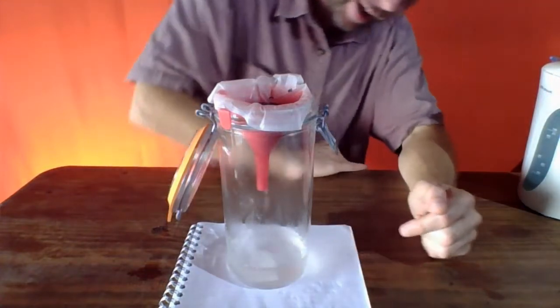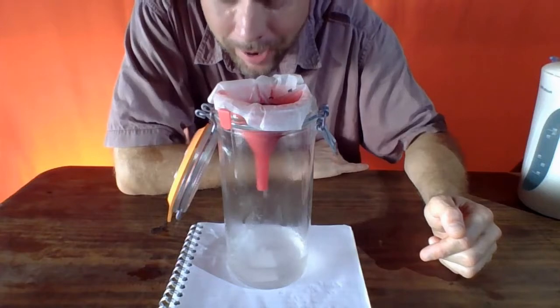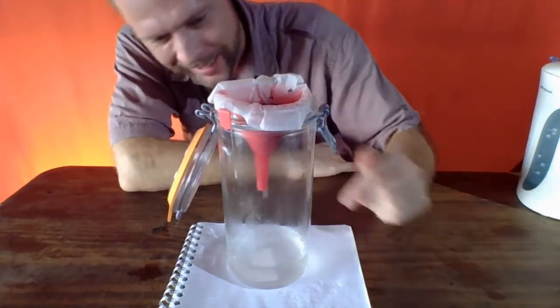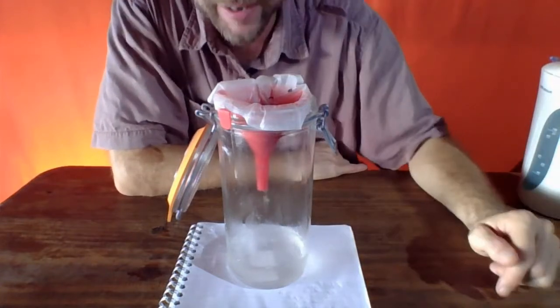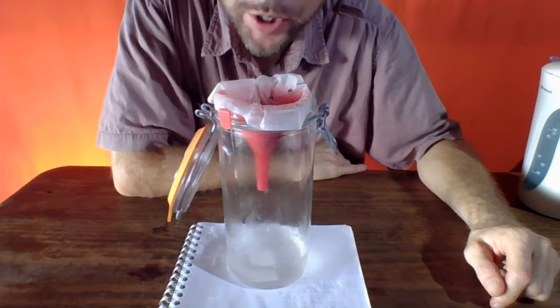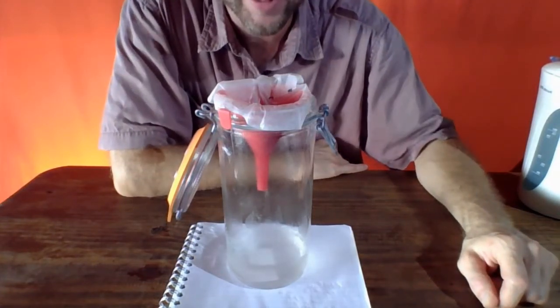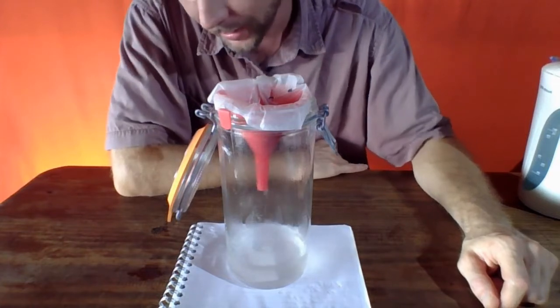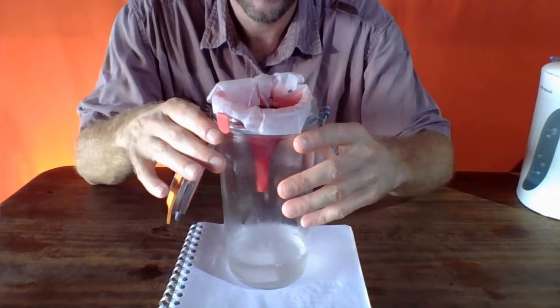I'm not sure if you can quite see the edge of the water or not, but we can see it dripping down. It's been going for maybe 10 minutes or so now. It's about done. And again, I see no evidence of anything black down in the bottom. It's looking pretty black up top. I'm not seeing any evidence of salt remaining on the top. And it looks like it's just about done here. We'll take another look at this in just a moment.